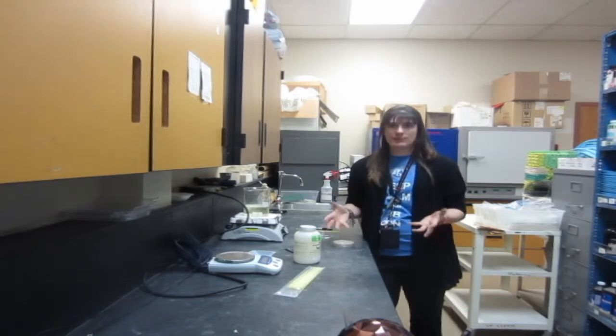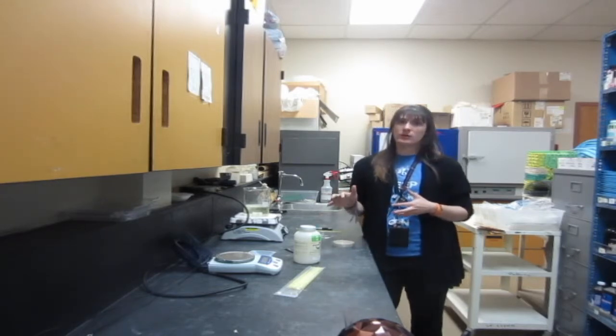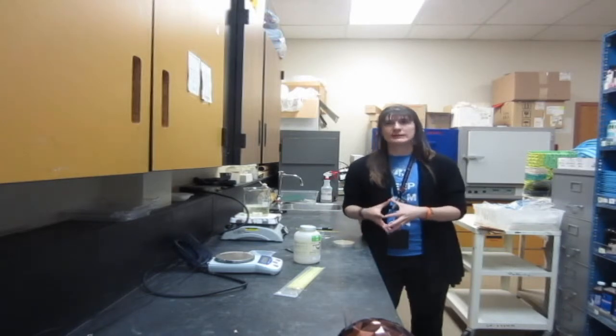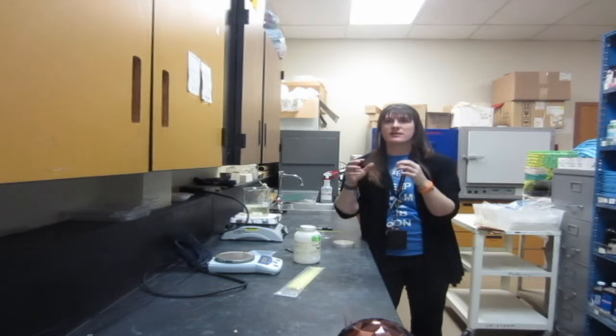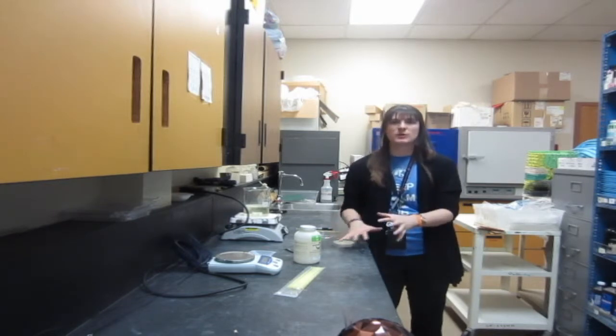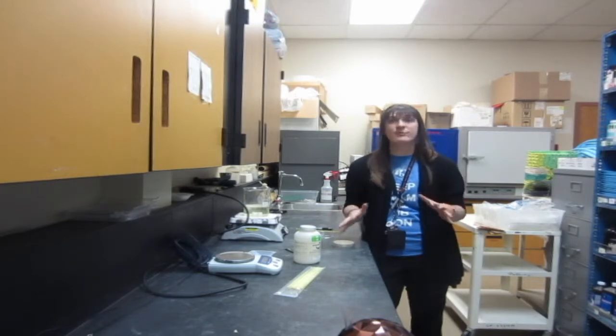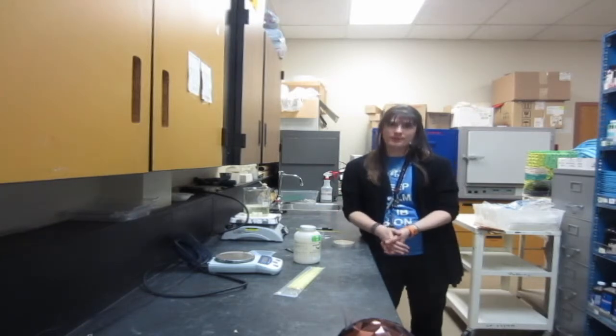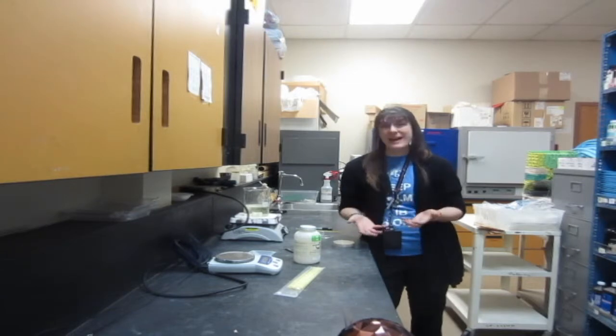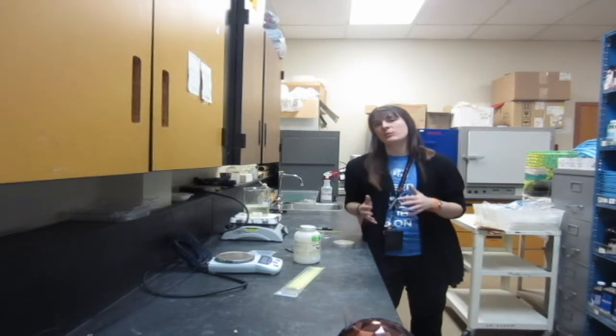The first thing I want to say before we get started is that this is not a totally sterile process. If you're working in a real lab you would have a whole different setup where you had access to an autoclave. If we had an autoclave we could heat all this stuff up to 121 degrees Celsius. You could make sure that all the bacteria are dead before you start so that you know you're starting with something totally sterile. For our purposes we don't have access to an autoclave, so we're going to do our best with what we have.